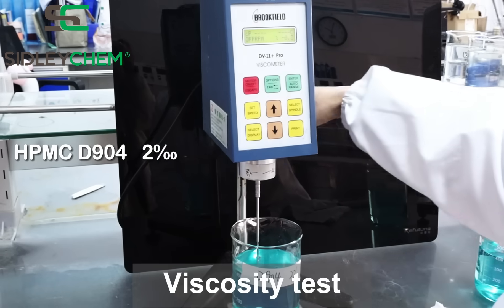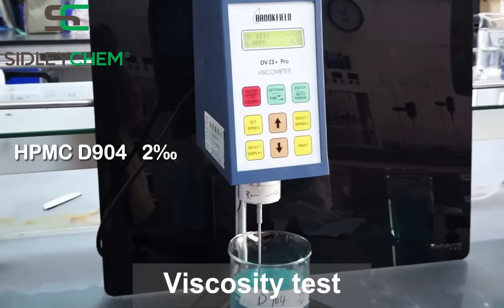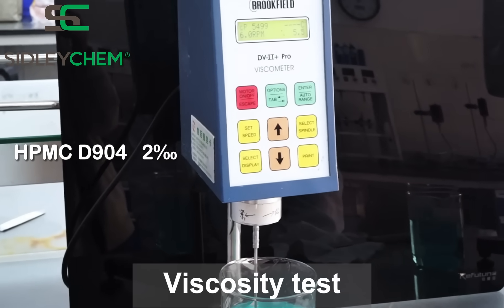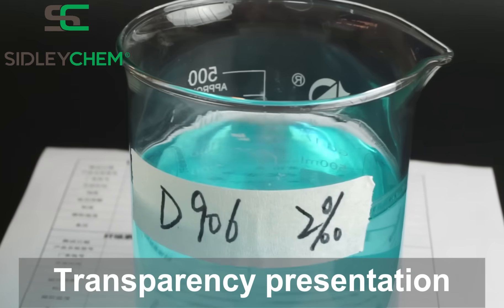Viscosity test, followed by a transparency presentation.